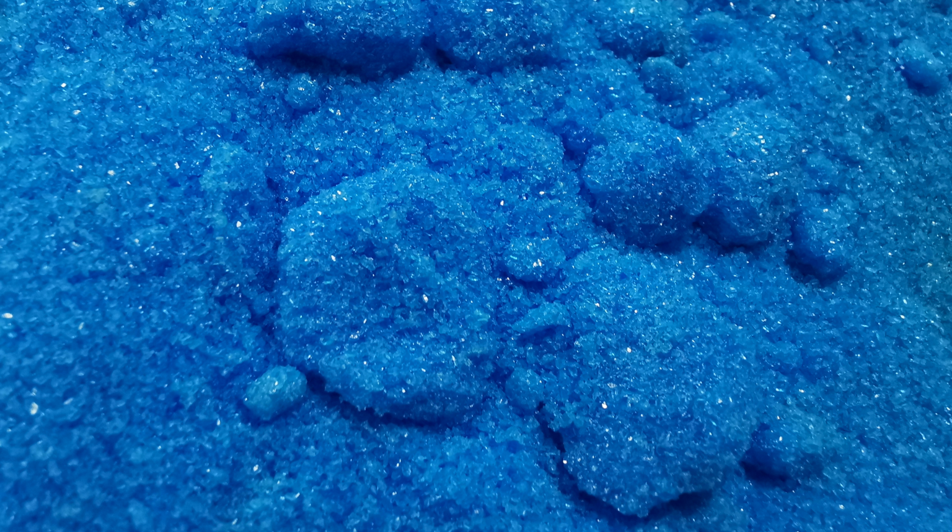We're going to use this to make a fairly saturated solution. Saturated meaning we will have dissolved as much of the salt as we can dissolve at that certain temperature. If you could still dissolve more, if you put more in and stirred it and it dissolved, then your solution was unsaturated. We want a fairly saturated solution. So we're going to dissolve some of this.